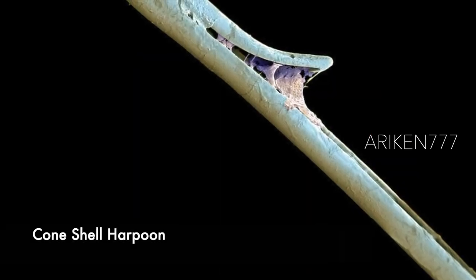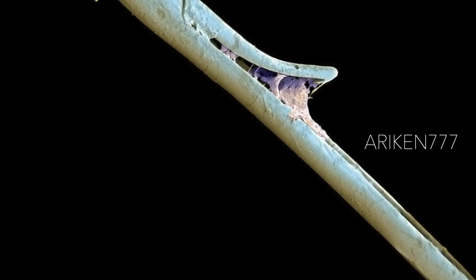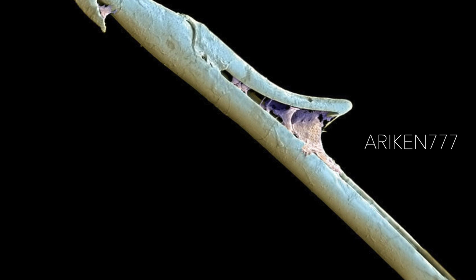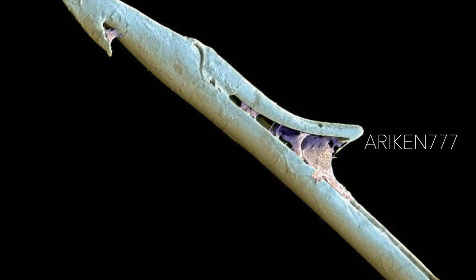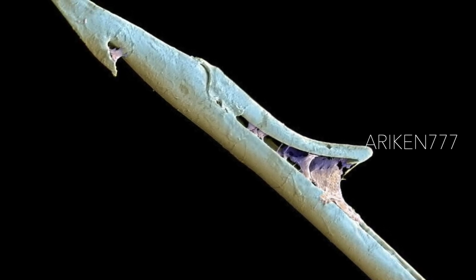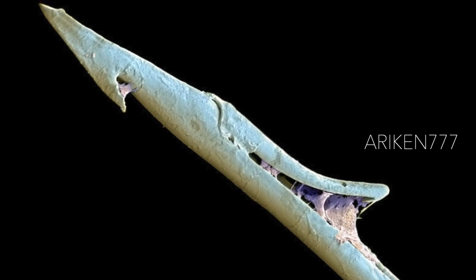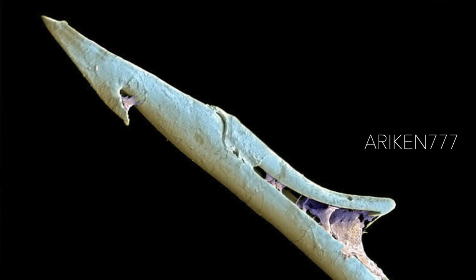The venomous harpoon of a cone shell, a type of marine snail. The cone shell is a predator that fires this harpoon into its prey, usually a fish or a worm. The venom paralyzes the victim, allowing the snail to devour it. The venom is highly toxic and several human deaths have been recorded. The venom contains proteins called conotoxins, which contain the amino acid gamma-carboxyglutamic acid. This is involved in the blood clotting process in humans. Study of the snail's biochemistry could lead to new drugs to treat clotting disorders such as hemophilia.